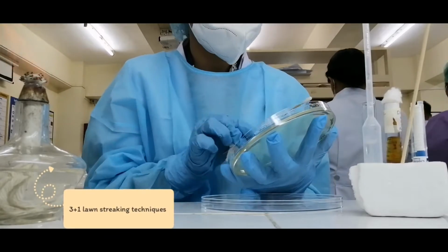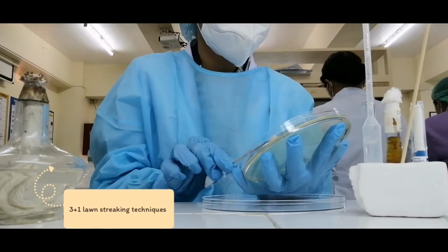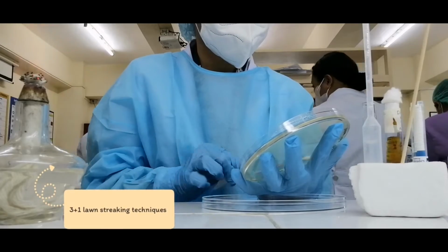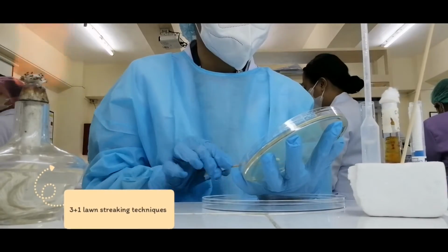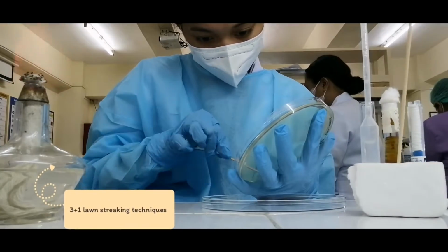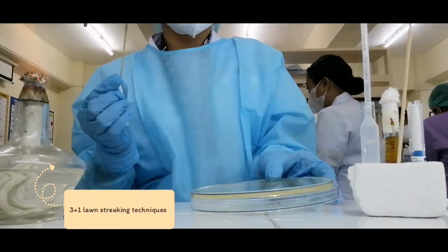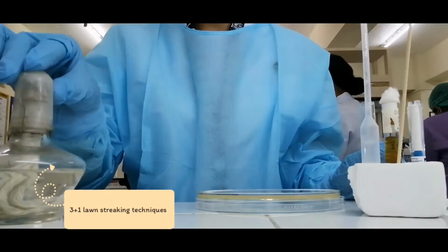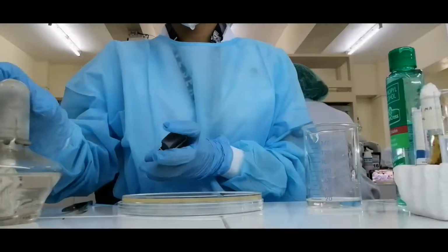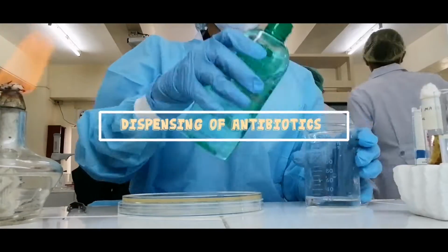For the third swab inoculation, rotate the plate and use the other side of your swab, but don't re-inoculate the swab. Then, allow the plate to stand for 10 minutes at room temperature. Once the lawn of bacteria has been created, the antibiotic disc can be applied to the plate.